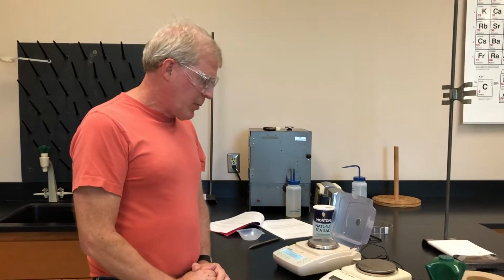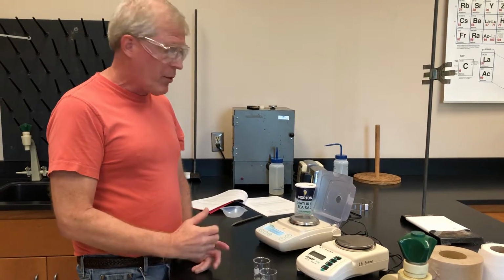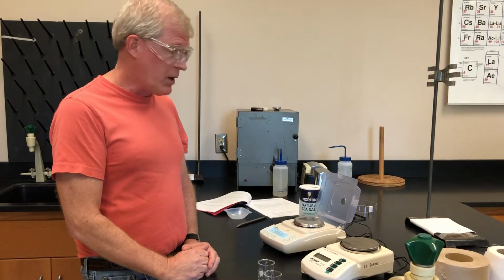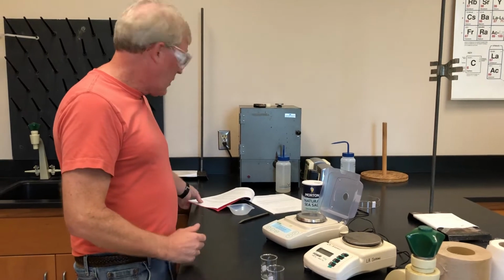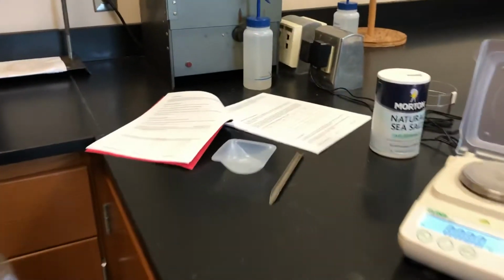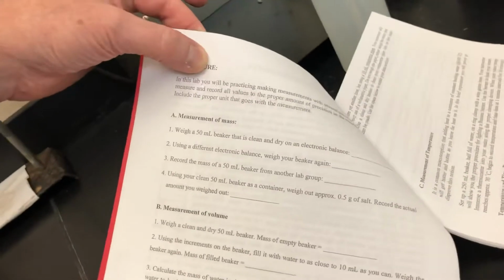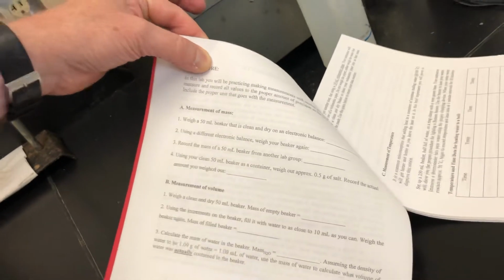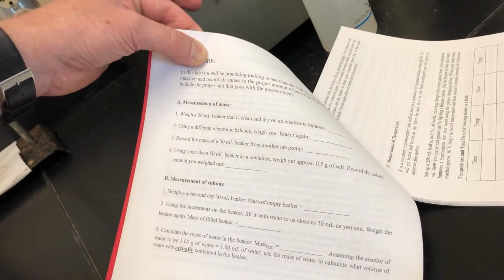Going to show you a little bit about how to use these electronic balances here and proper techniques for that, and little quirky things about the electronic balance. The first task that we have, I'm looking at the lab manual that you all should have access to, and it says we're supposed to weigh a 50 milliliter beaker that is clean and dry on an electronic balance. And then we're going to use a different electronic balance to weigh the beaker again.